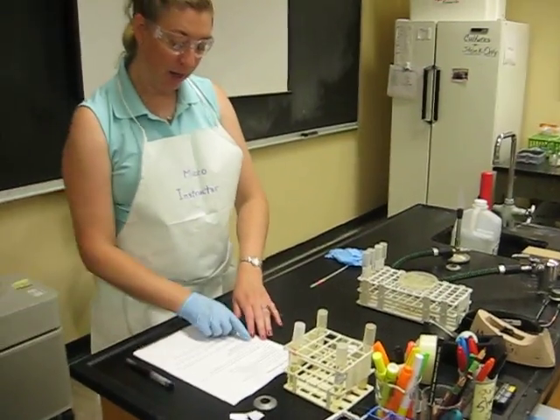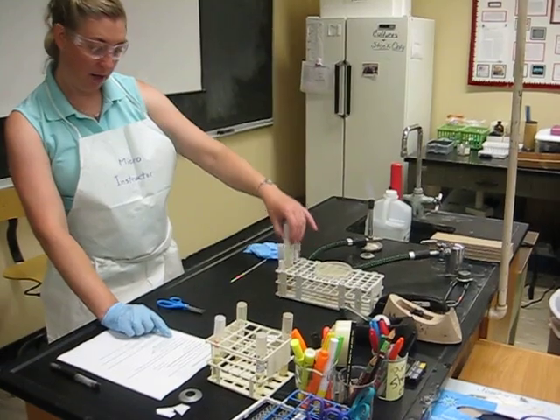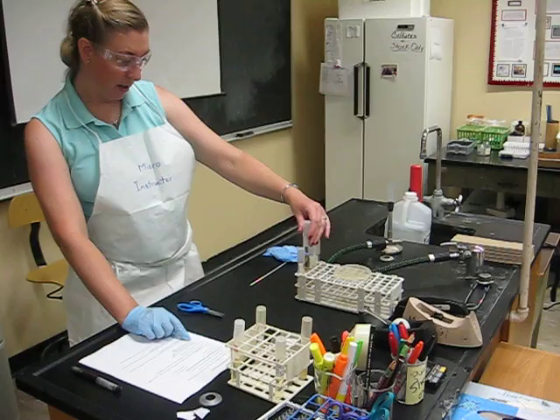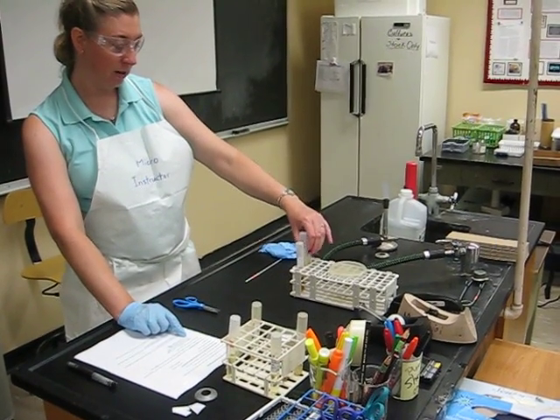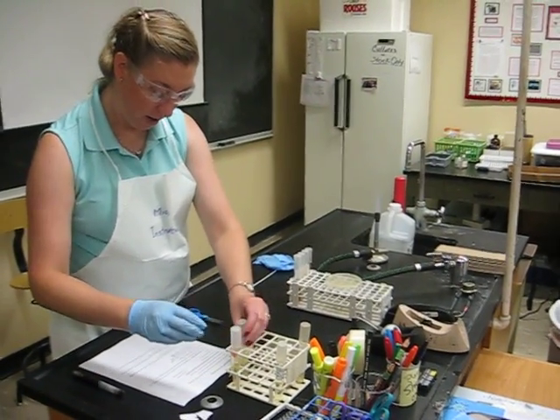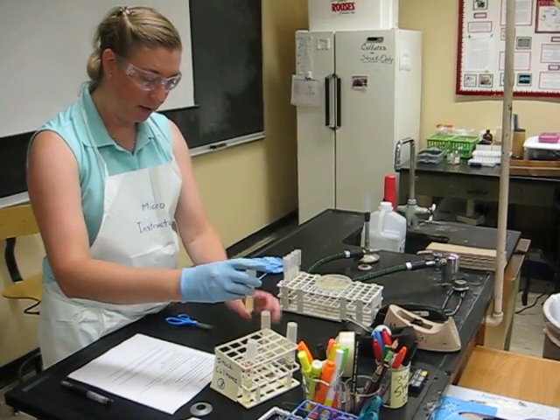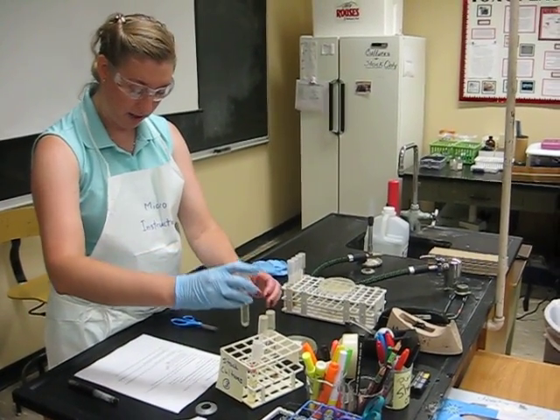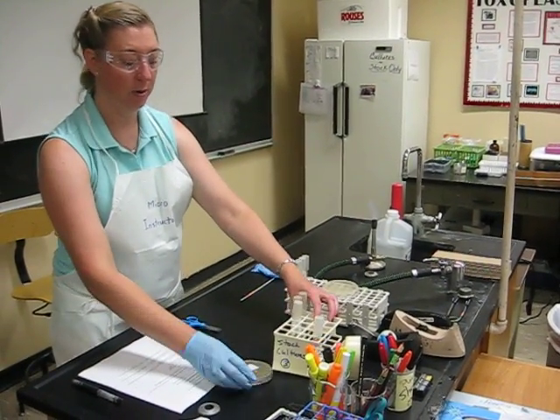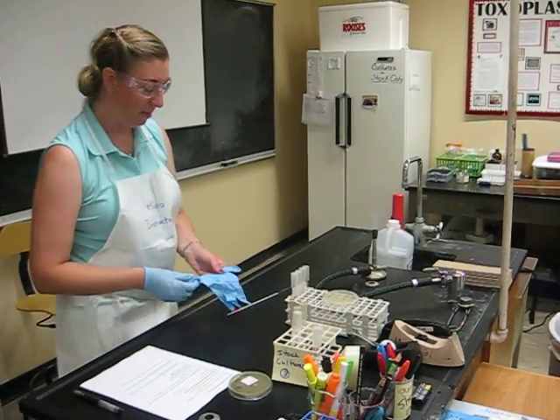Then I'm going to go by my checklist. The first one's going to be Staph epi, then Klebsiella. I'm just putting these in order of my list so I can follow it. It's going to go one, two, three, four. I'm doing Staph epi, Klebsiella pneumoniae, E. coli broth, and then the plates. So I have it all organized. I'll put my glove on and keep my workspace clear.